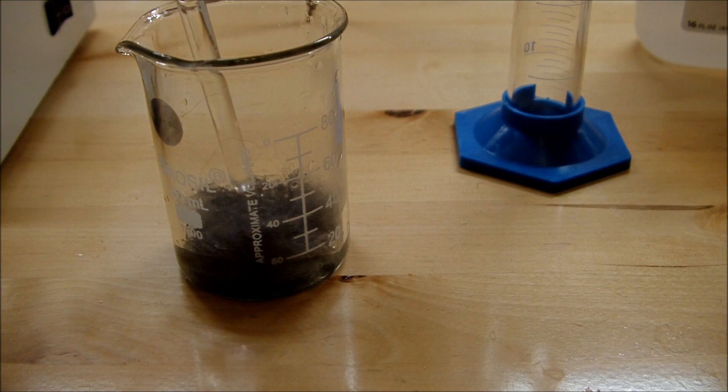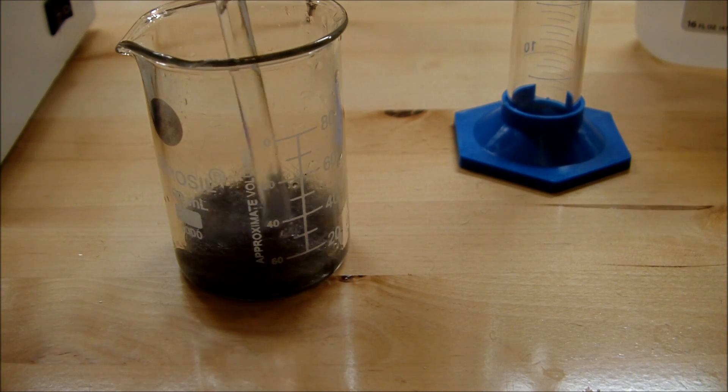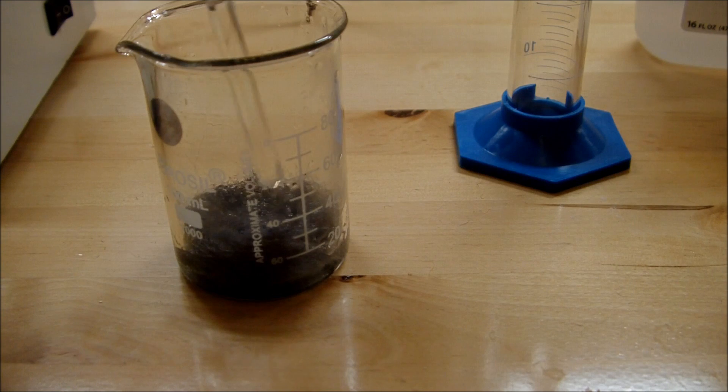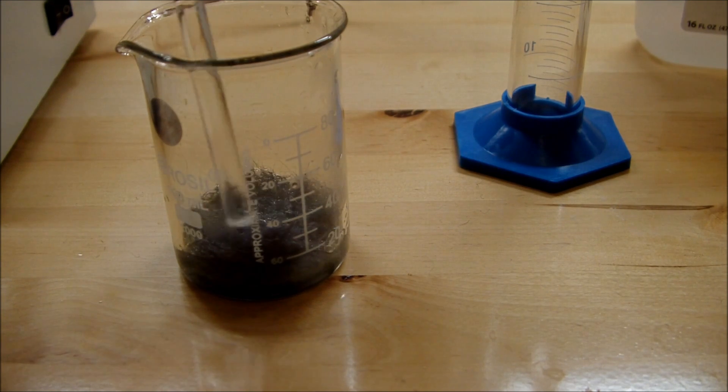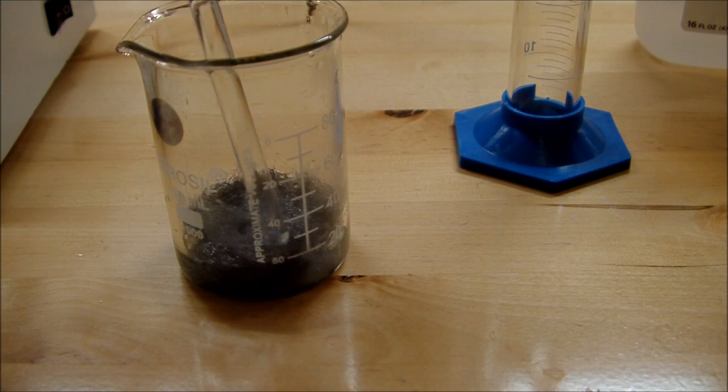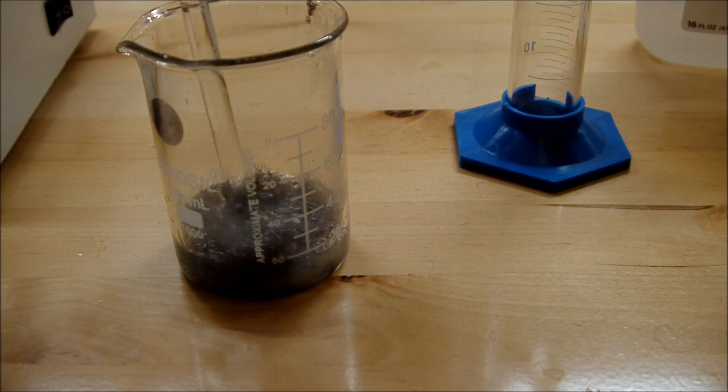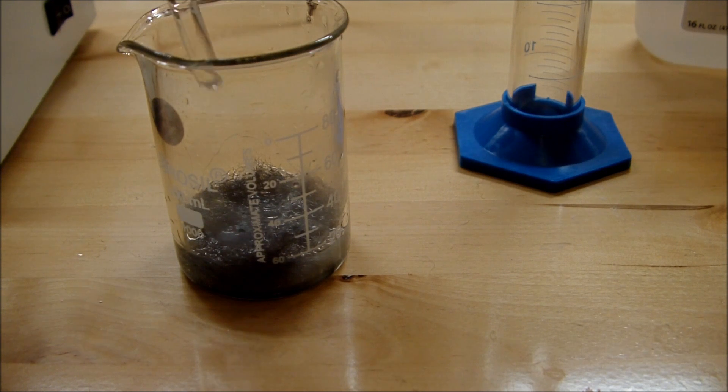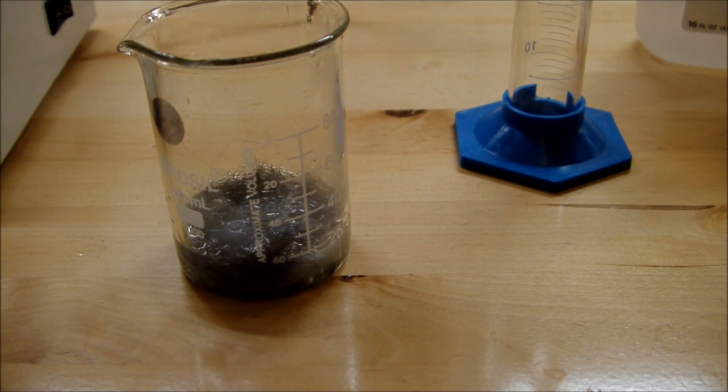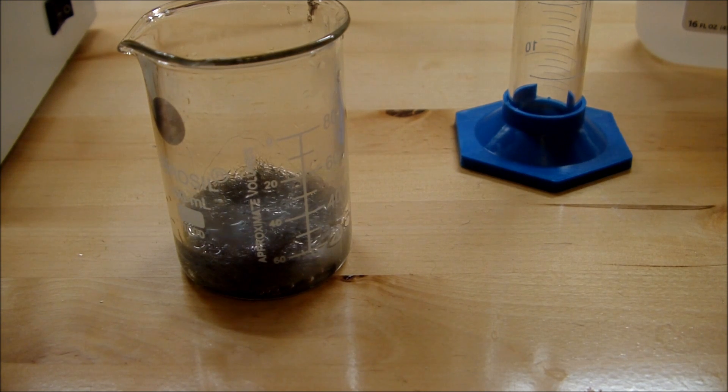This reaction produces iron 2 chloride and hydrogen gas, so there'll be a little bit of effervescence from this. We'll just mash that down to make sure there's contact between everything. And if you listen, you can hear some of the bubbles happening, and you can see them as well.